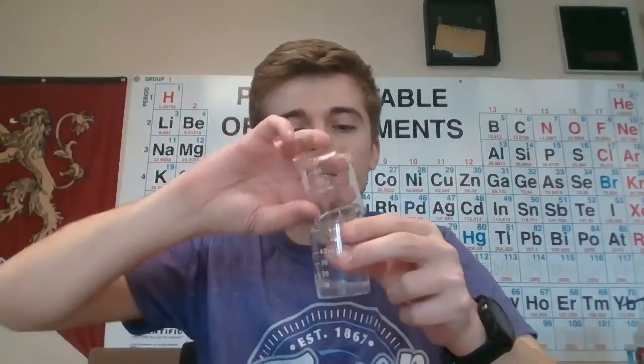This is for 5 degrees Celsius. I'm mixing them together and we're going to time how long it takes to turn blue. We'll just keep watching it. And there we go, it's blue. So record that time, and then whenever you have that time recorded, come back for the next trial.